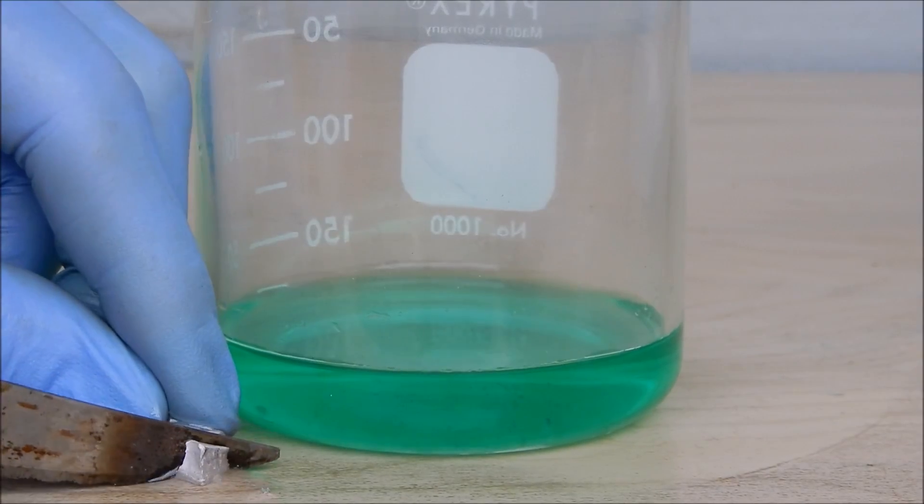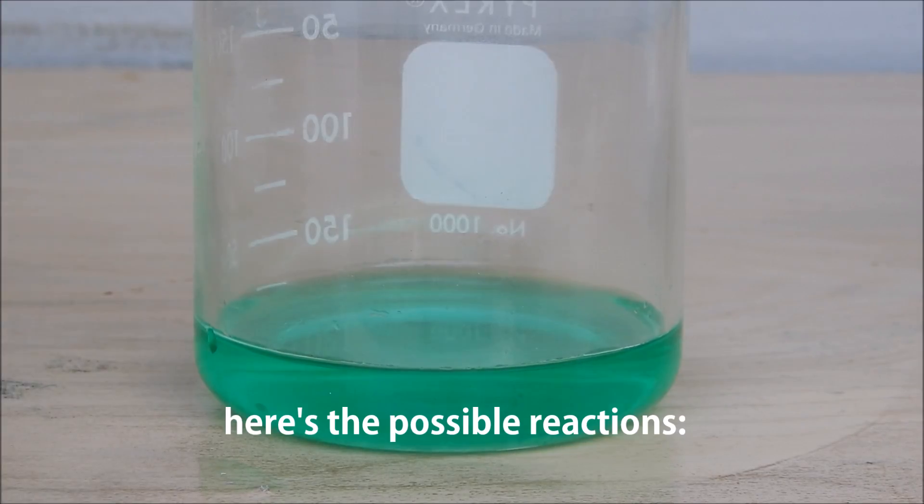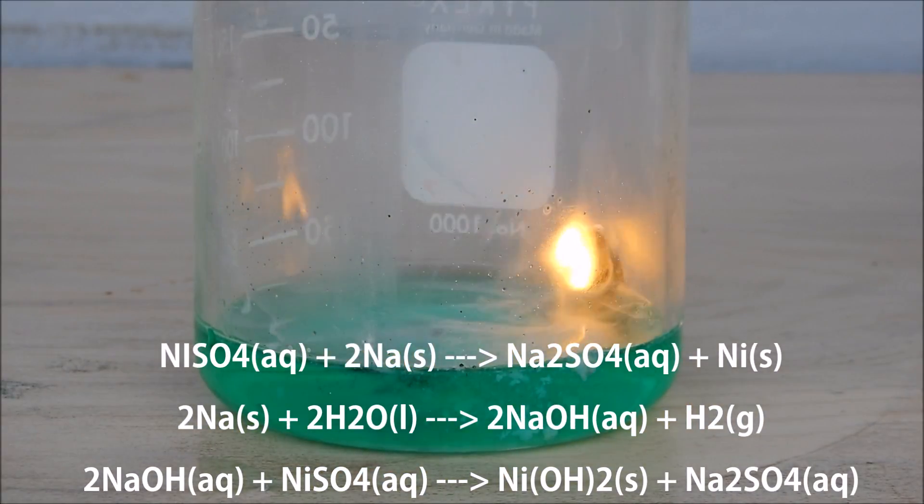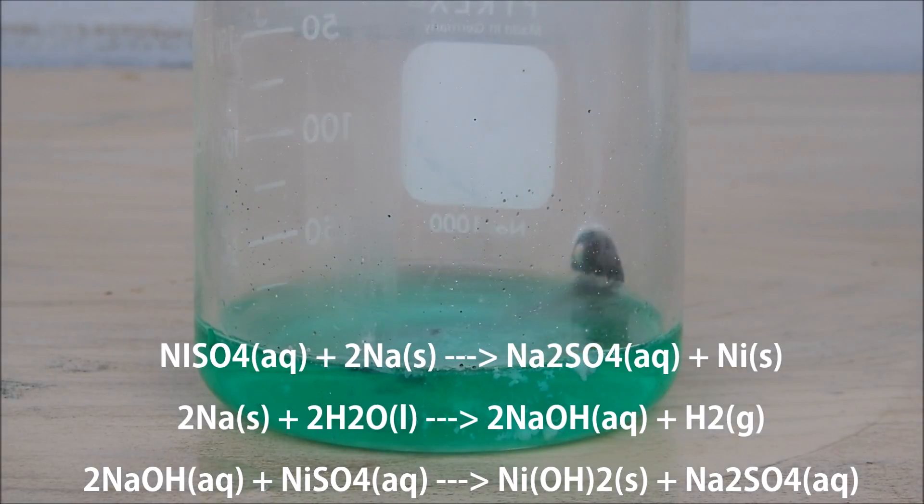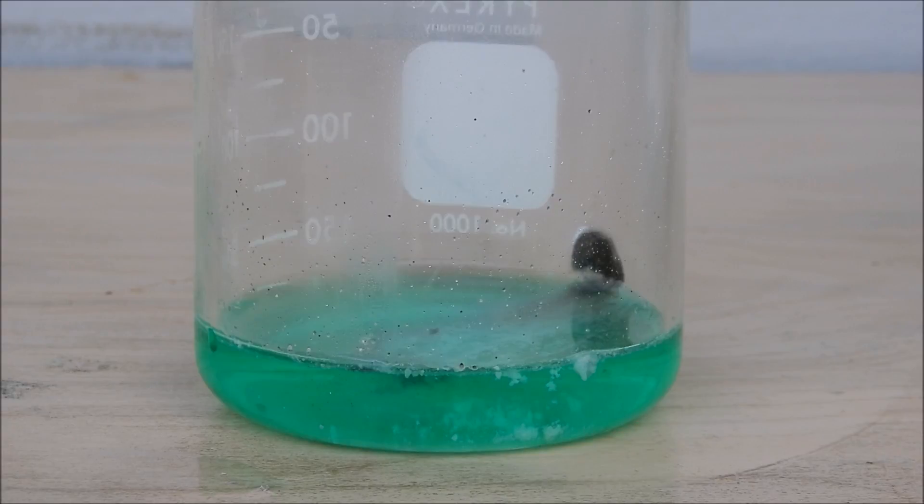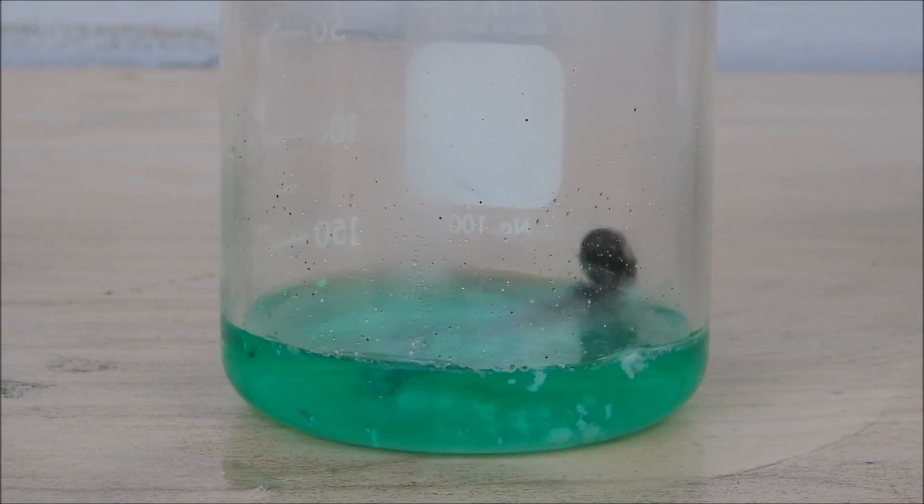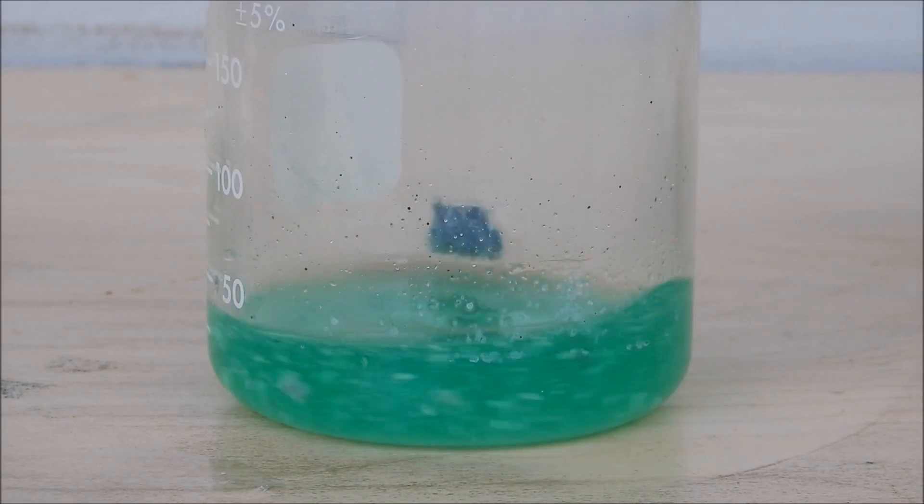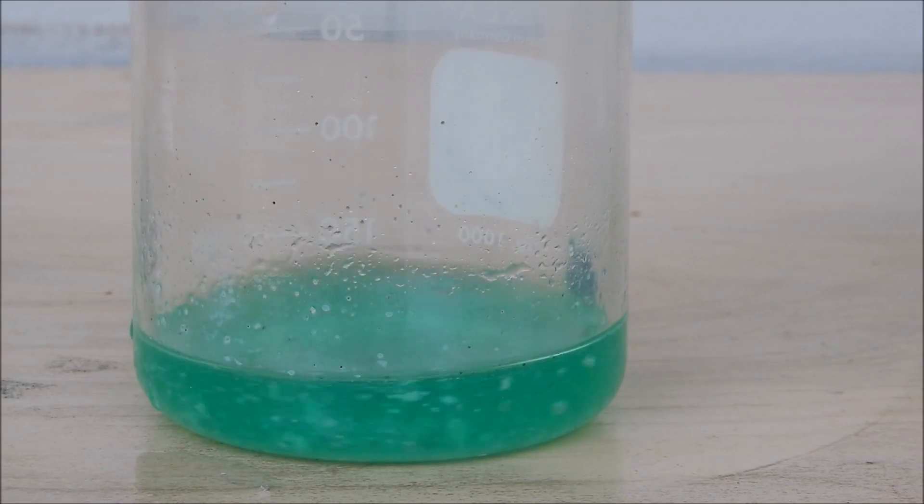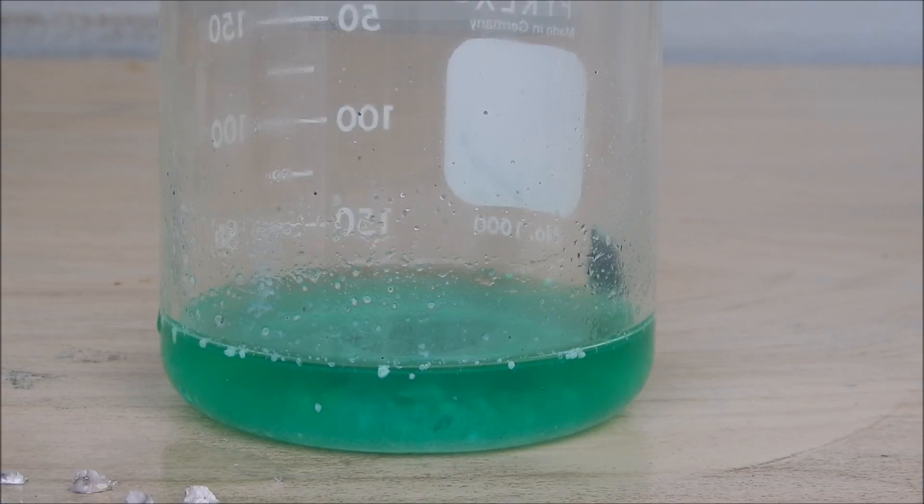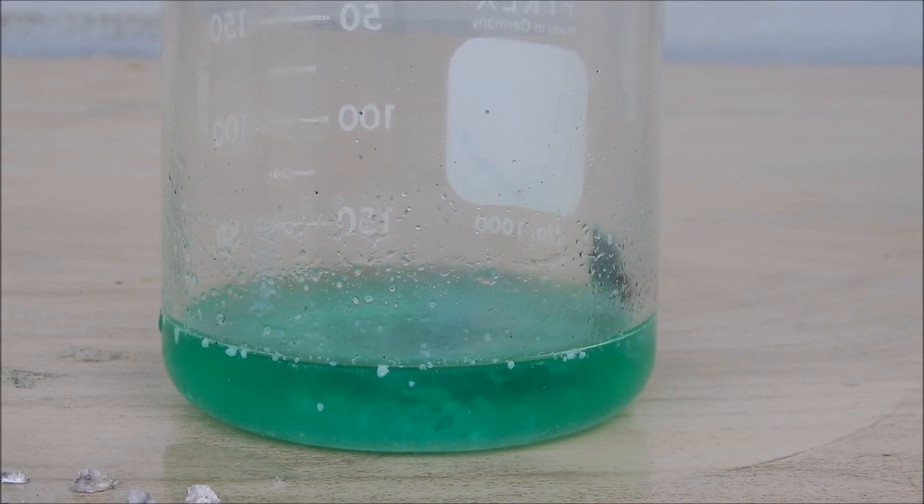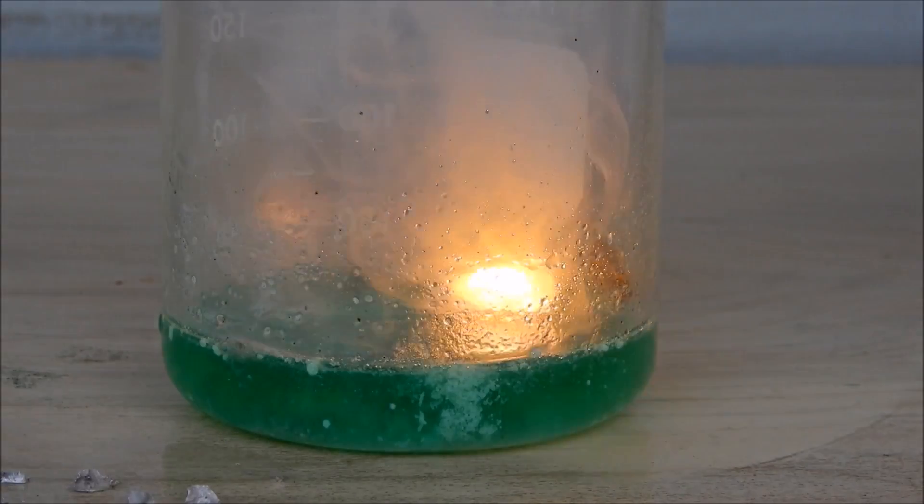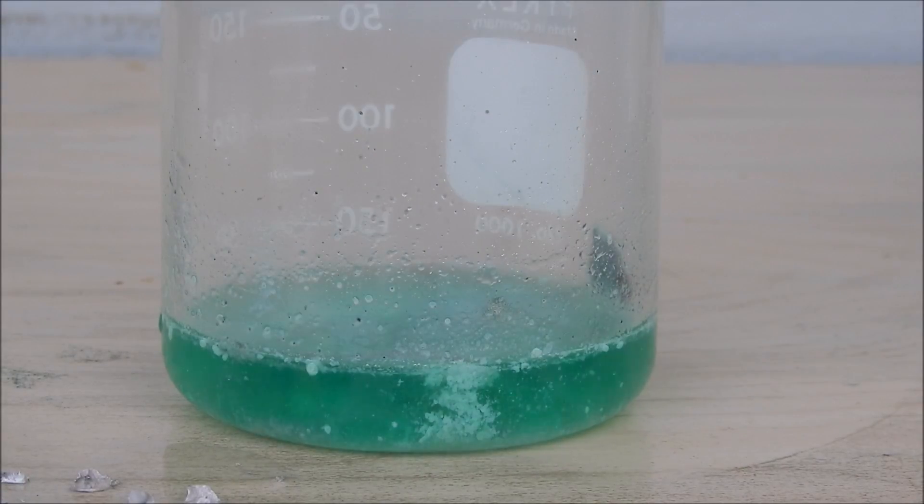Let's cut off super small pieces. Yay, nickel metal! Please don't break my beaker. Okay, I see black bits in it already, so that's good. Let's keep adding. And the white stuff you see is sodium sulfate. Nice, okay.